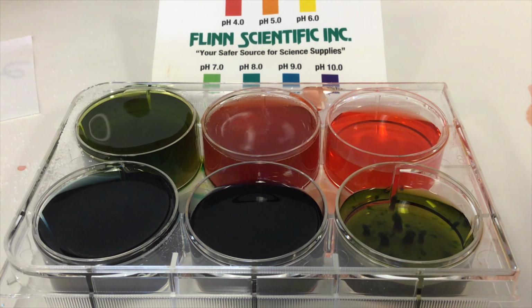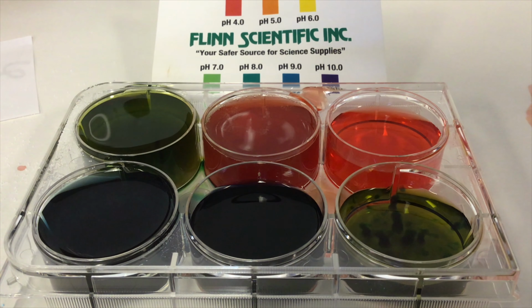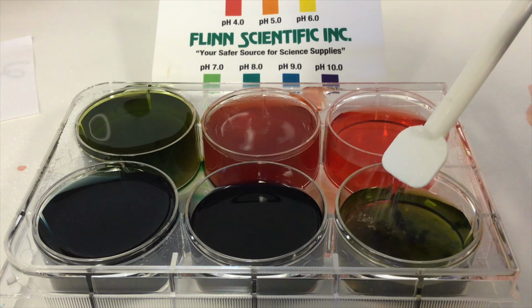The last example I have is sodium phosphate monobasic, and its formula is NaH2PO4. Out of the ions, sodium is +1, and the other ion is H2PO4 -1. Which one do you think will interact? And do you think an acid or a base will form? Form your hypothesis or your guess, and I'll put some substance in.